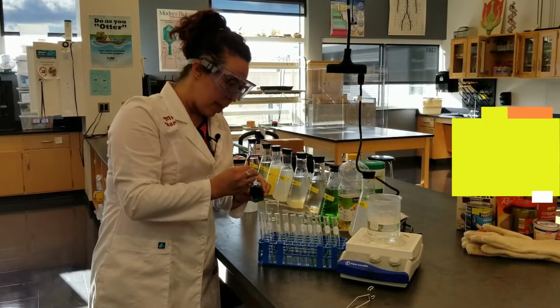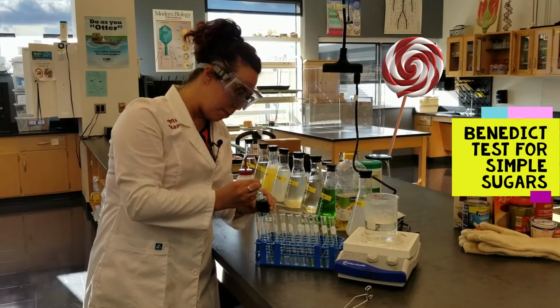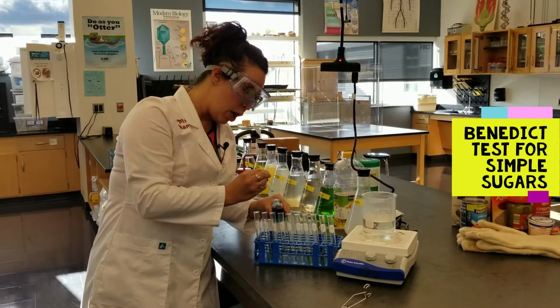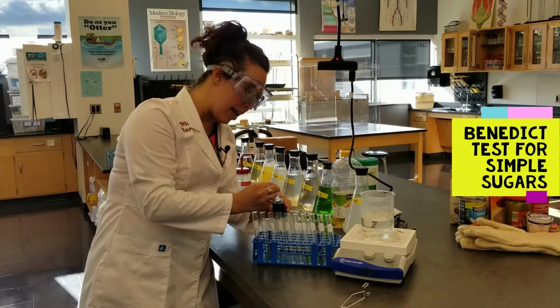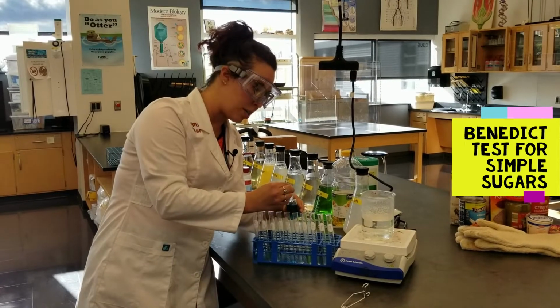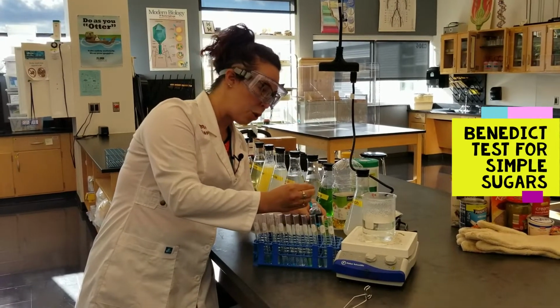We're now going to test for a type of carbohydrate known as simple sugars. These are found in sweet treats like candy and fruit and cakes. The indicator that I'm adding to each of the food samples is called Benedict's solution. This is blue and is irritating to your skin. So of course we're going to exercise precaution, wearing our lab apron and our goggles.